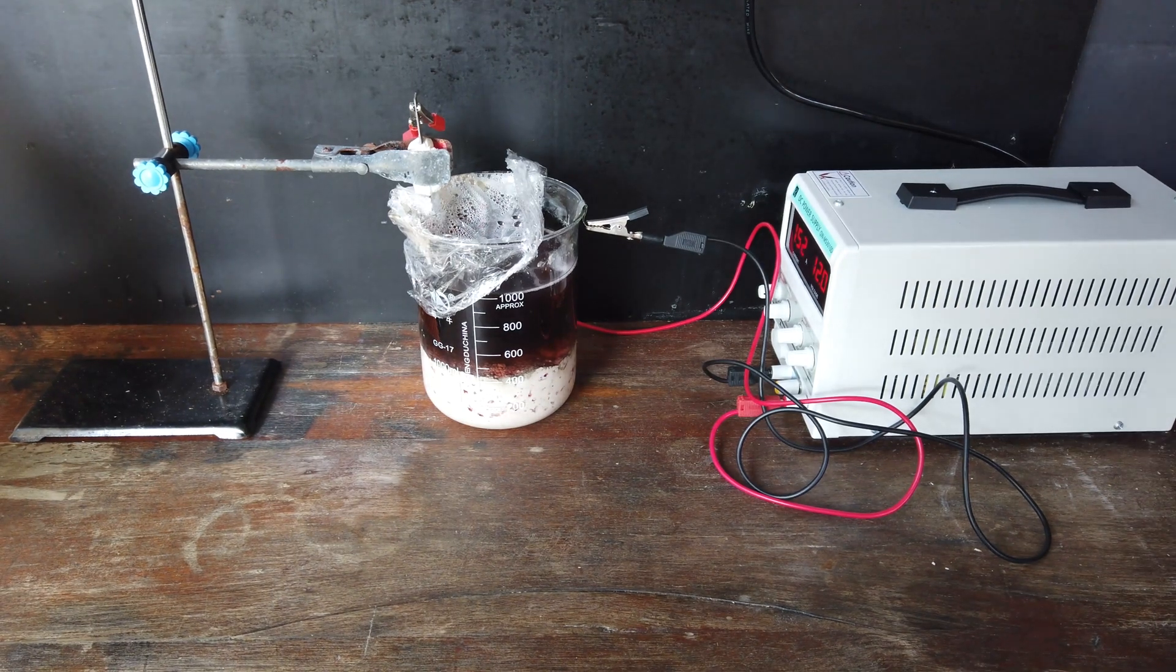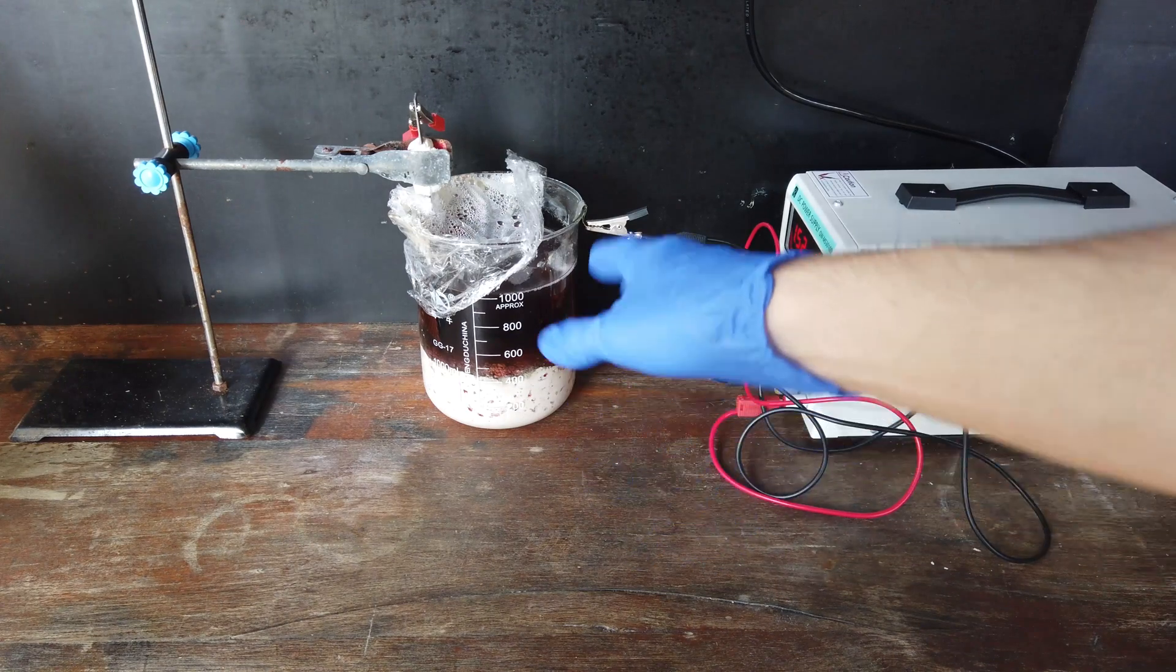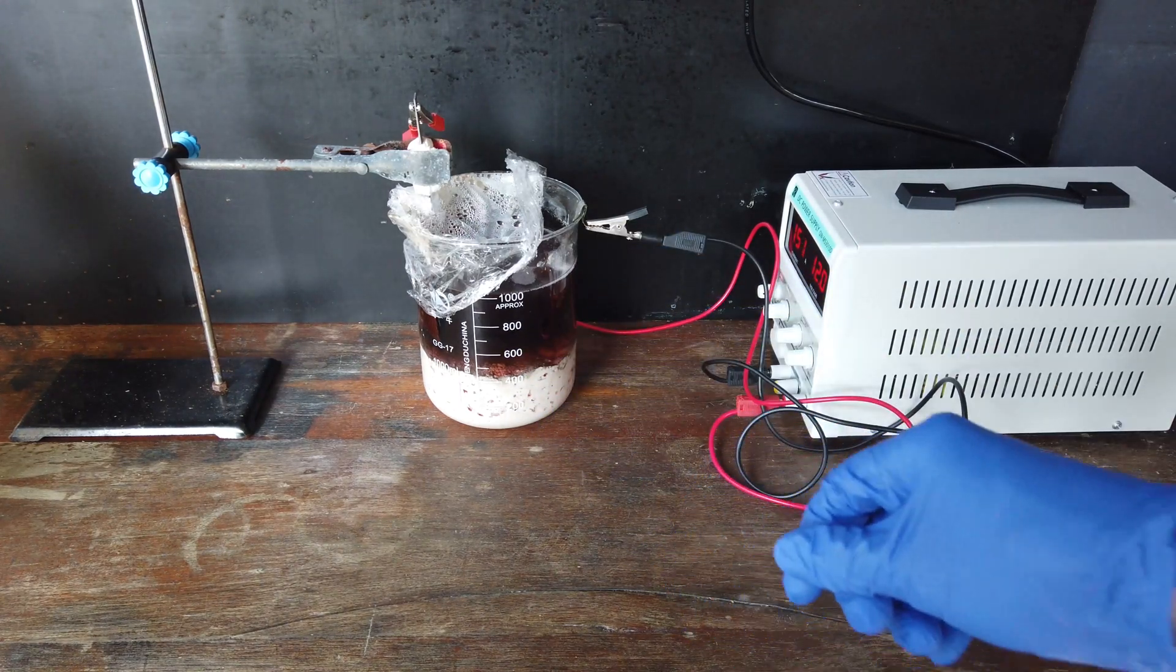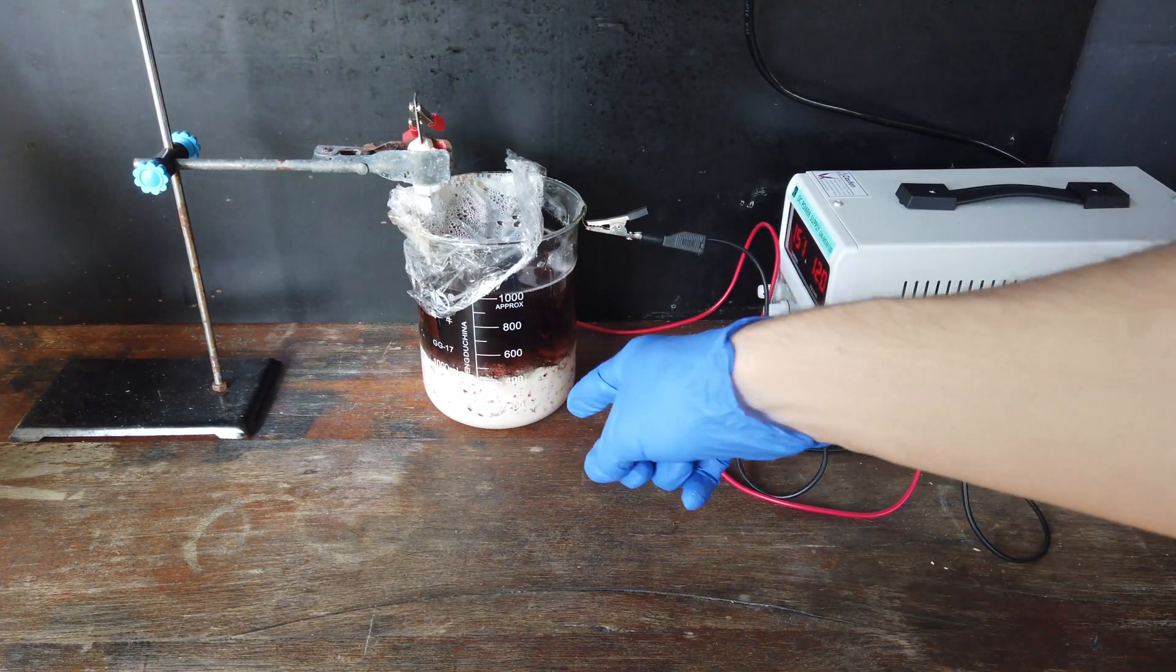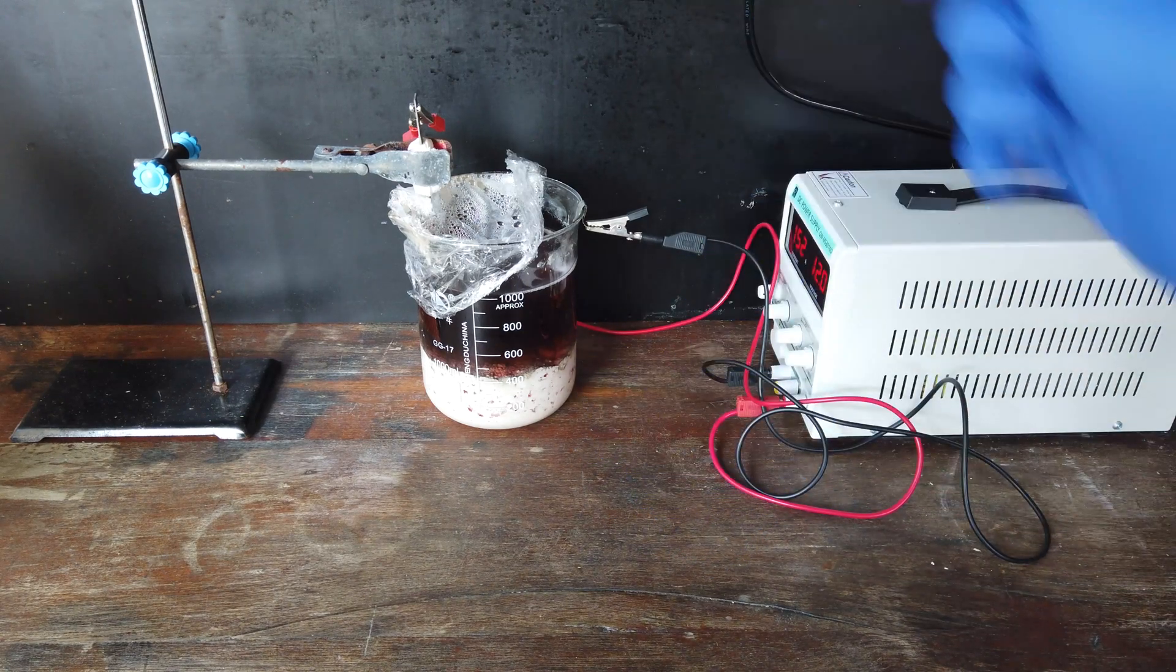Additionally, I will be giving it a stir every now and again. Just to make sure that the sulfuric acid that we're generating as a byproduct does actually go on to react with the hydroxide precipitate at the bottom of the beaker.